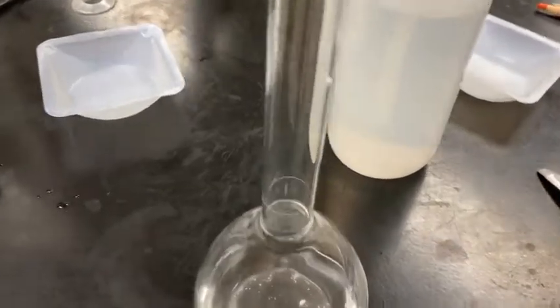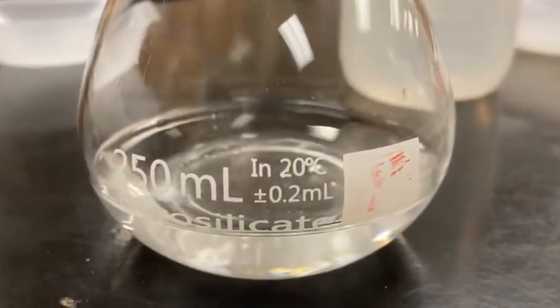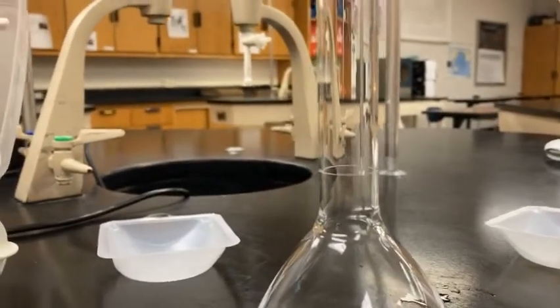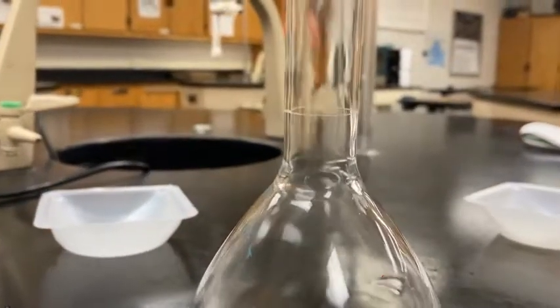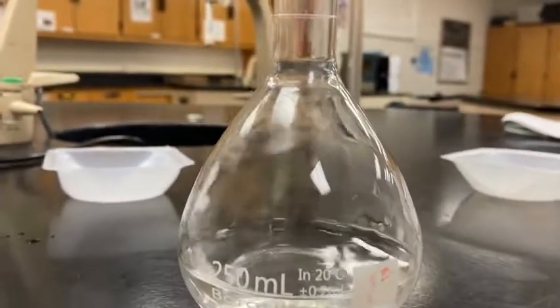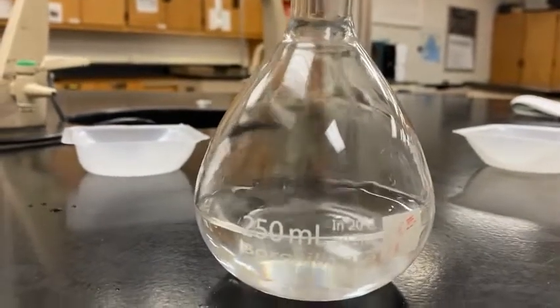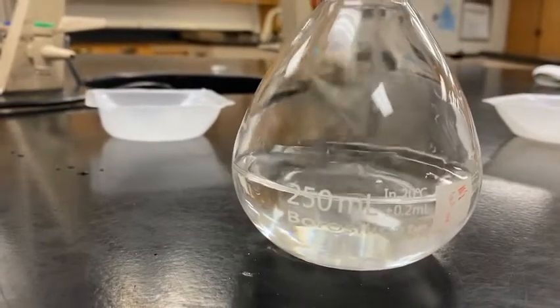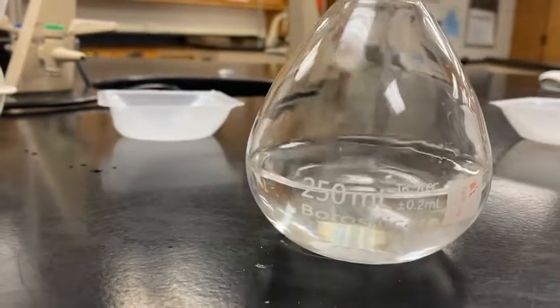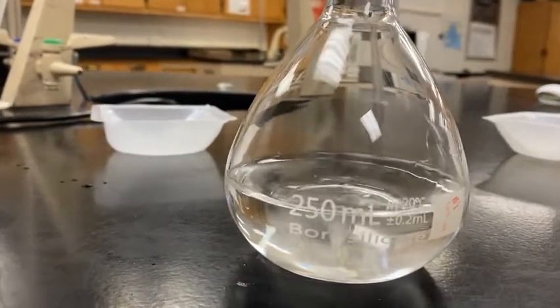All right, I've just added the sodium hydroxide in. You can see some of it is sitting at the bottom of the flask. I've added some water, but all I'm going to do is, with my squirt bottle here in the back, just continue adding water until my water line is up to that line in the volumetric flask, and that's when I'll stop. I want the bottom of the meniscus right on that etched line. As I go through to make sure all of that solid sodium hydroxide dissolves, I'm going to stop intermittently and swish around the flask, to make sure it all dissociates and breaks up into its ions. And then when we come back together, I'll show you the end product of the solution.